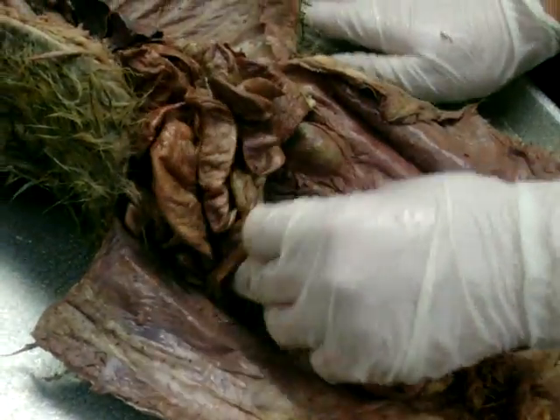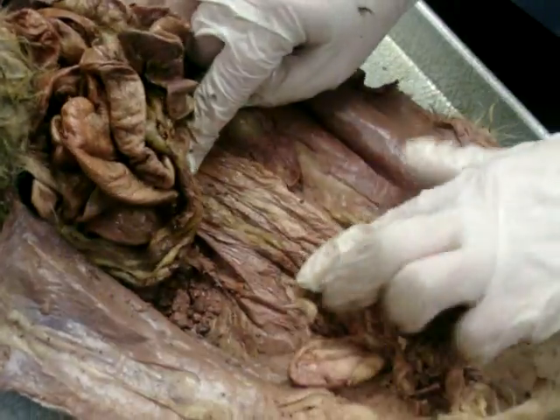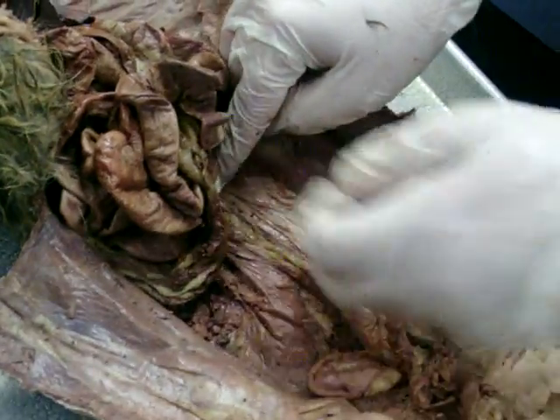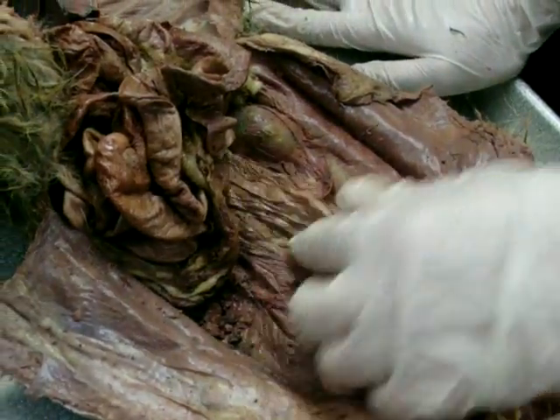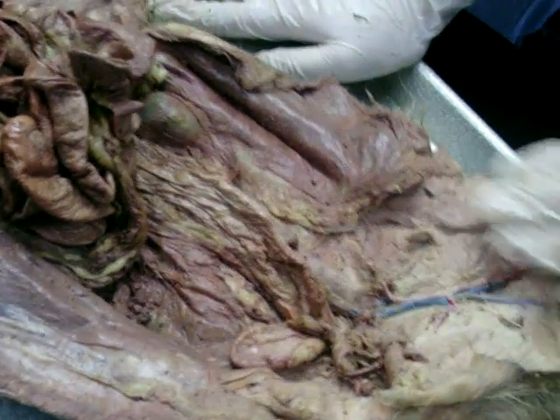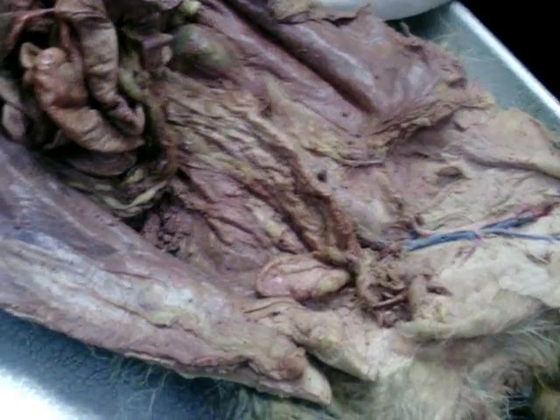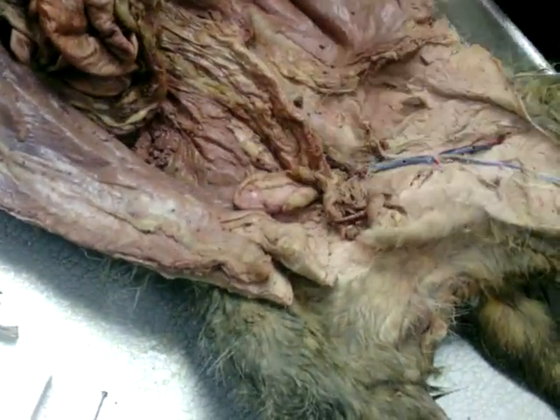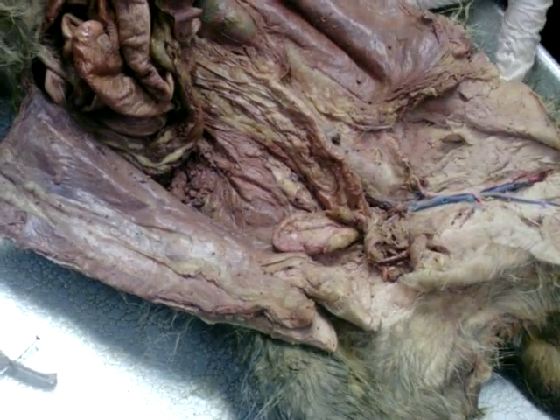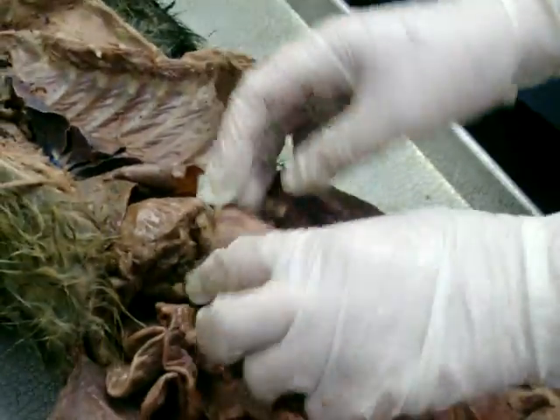Okay. All right, and so I don't know if there's any real clear division between where it becomes cecum and where it becomes the next part, but I would say when it starts to go vertical, kind of runs parallel along the spine, I would consider this to be the colon, okay? And then what's after the colon? The rectum, and then the anus, okay? I can label the anus, but I don't think I'll do that. But the rectum would be kind of back in behind here. Right? Yeah, and then you have the accessory organs.